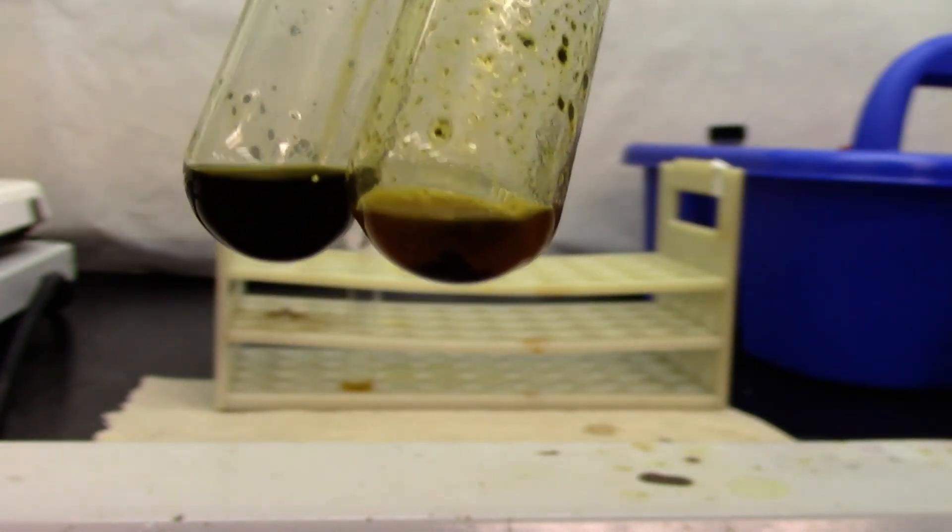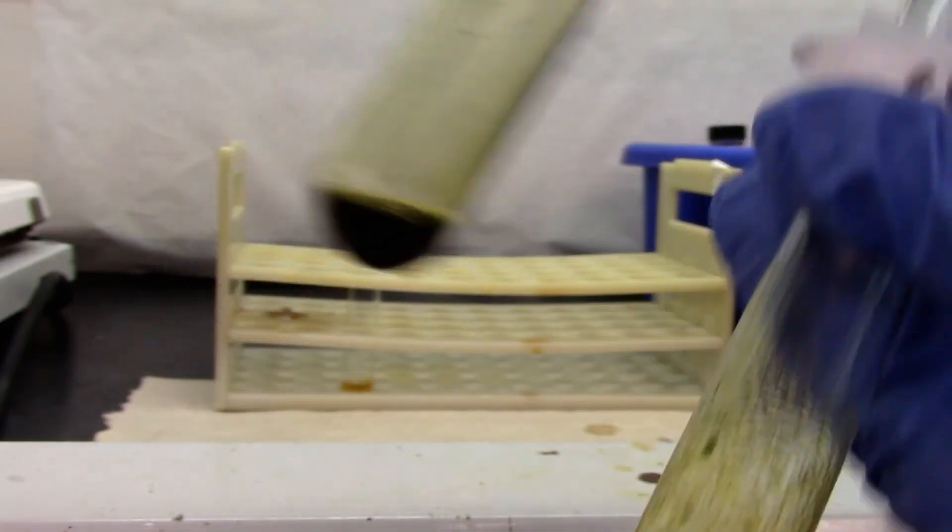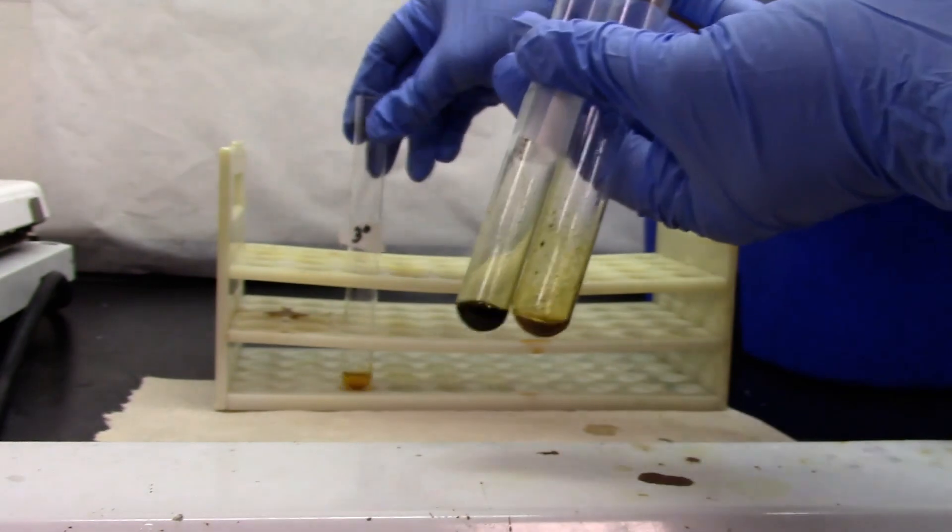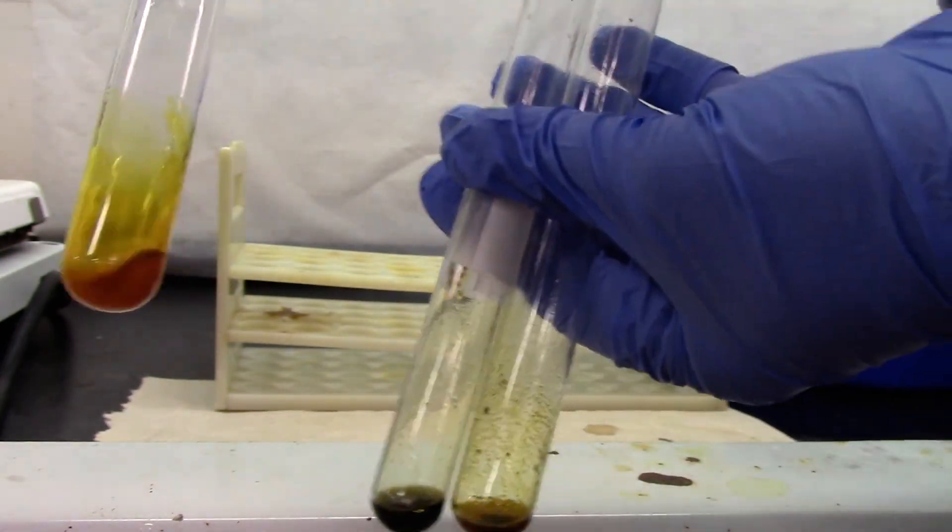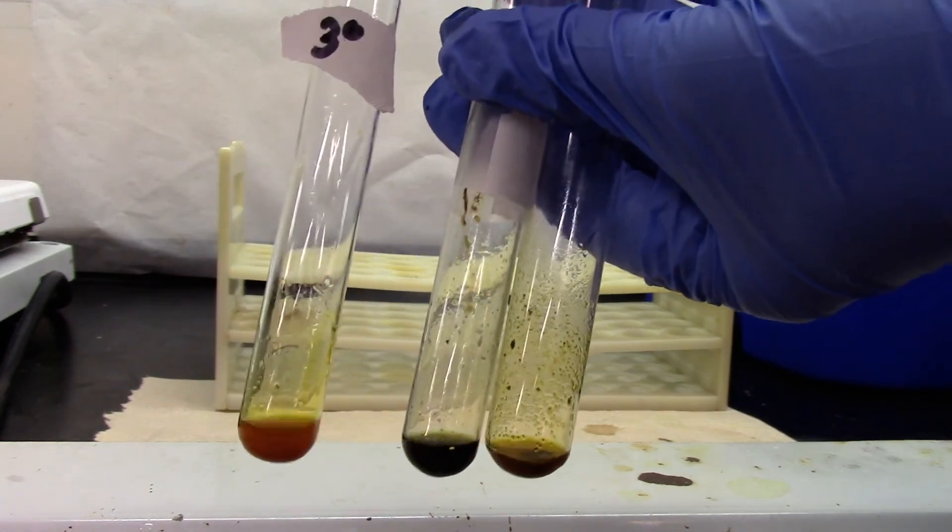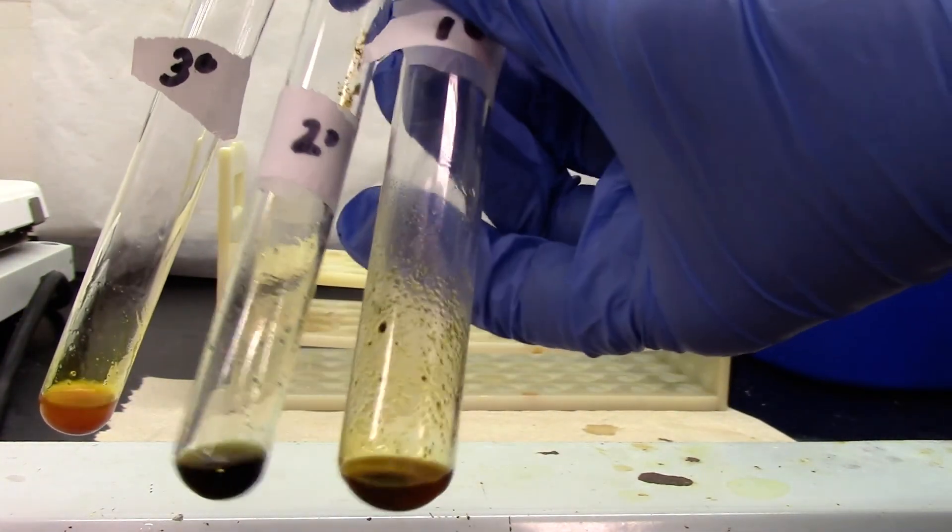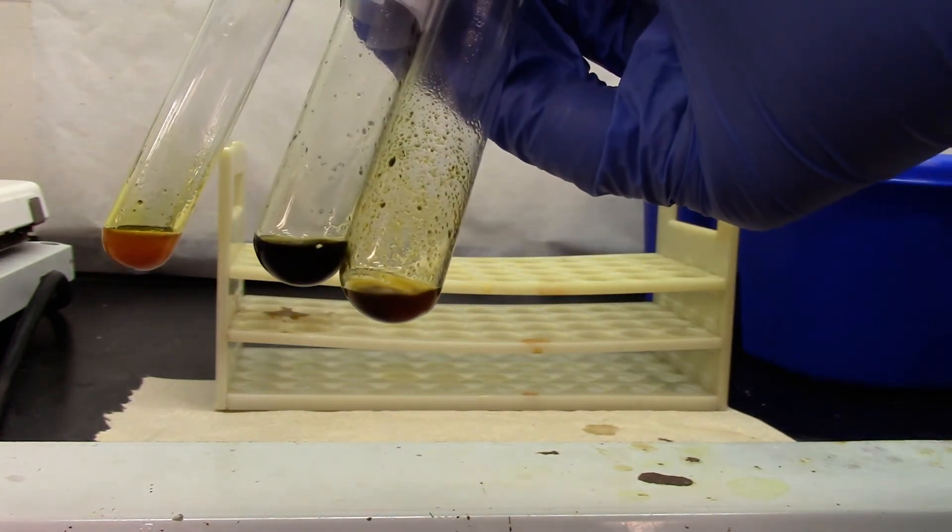This primary has a dark green precipitate in the bottom and this has a green coloration. While the tertiary should not react and it looks like the orange-yellow color. Clearly this is a negative test and these are your positive tests. Primary and secondary give you positive tests.